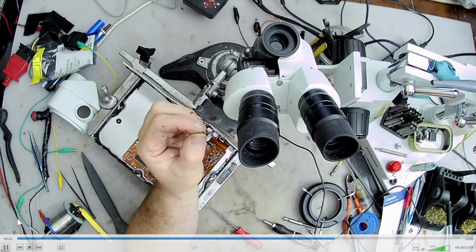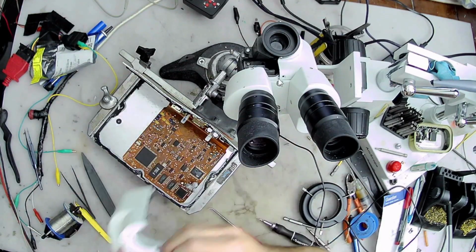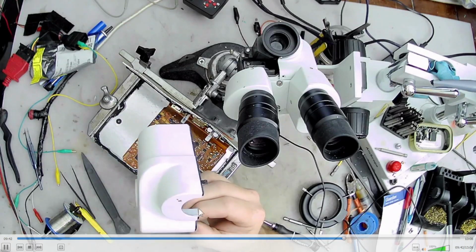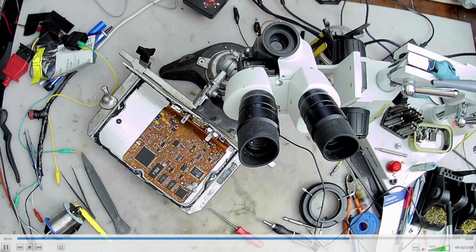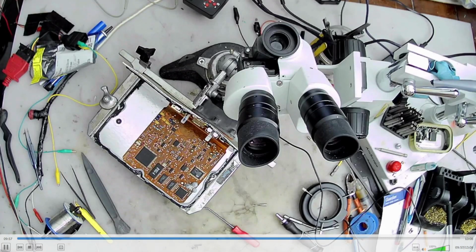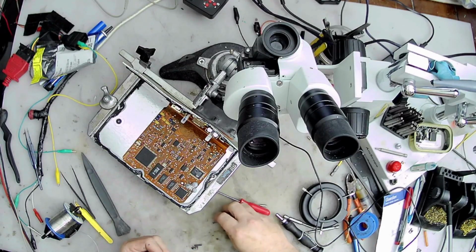But here I want to test. Oh, here I'm talking about that bar. This is the bar between the two cases here. And I want to test this before I fully put it together. But if it works, I don't want to have to take it apart again, unclick it again. So I'm going to go ahead and put the bars on this one side of the case. So you'll see, I just screw in this one side and get it nice and tight. And that way I can stick it together. And if everything is good, then I just put these screws in and put the 4 screws in the bottom, and don't have to take it back apart.